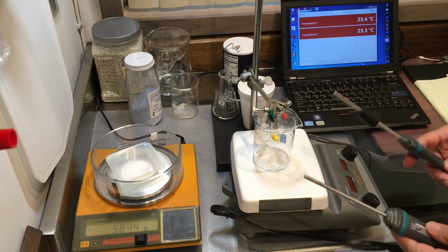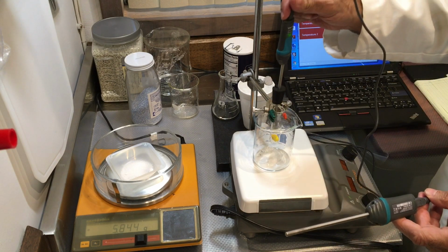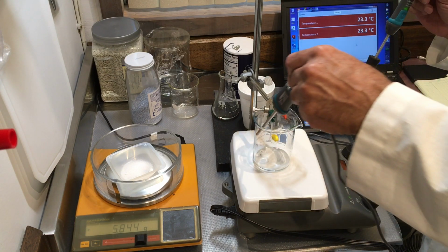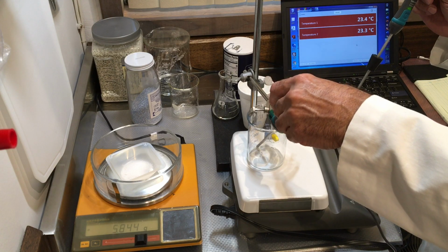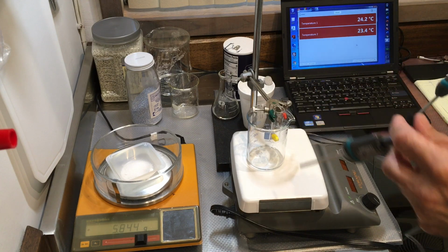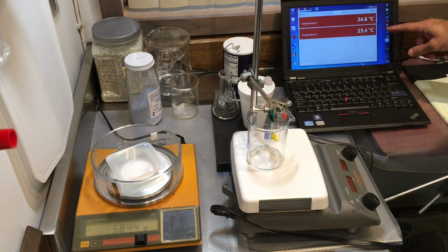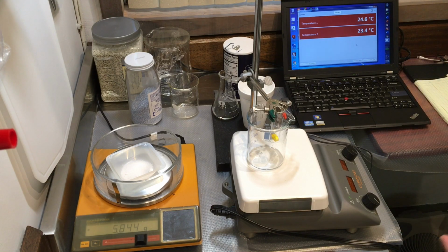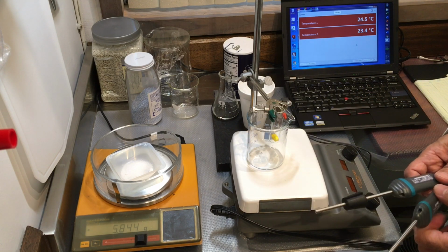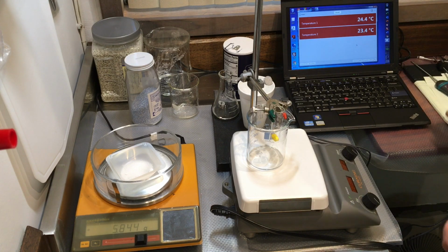And I forgot to tell you that I also have two thermometers here. One to measure the temperature of the solution inside of this little test tube, and the other one to measure the temperature of the ice salt water bath. And you'll see that this one gets really cold and we can monitor the temperatures. So the two probes are monitoring temperatures right here on this computer screen, and when I collect the data I can actually look at the temperature time data graphically. So that's going to be my other equipment to use.